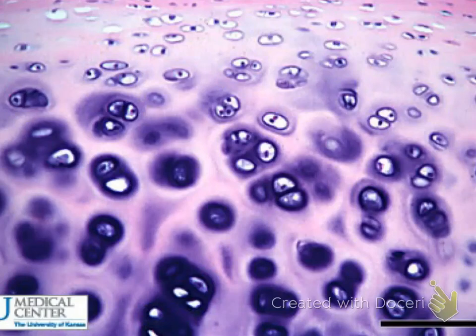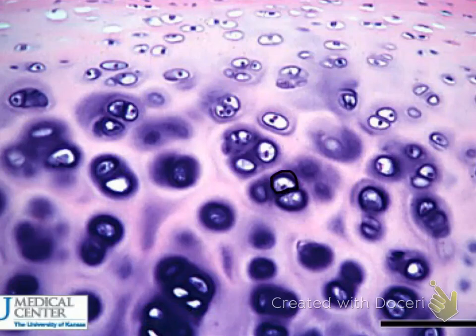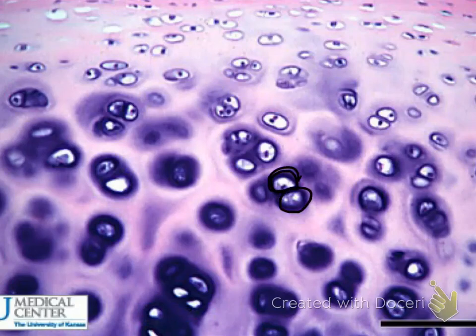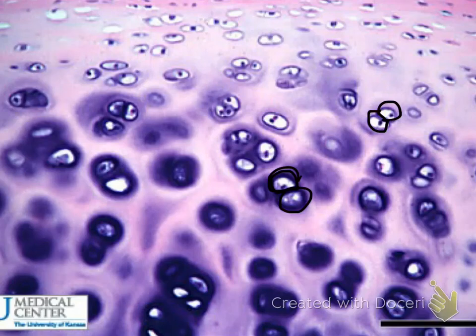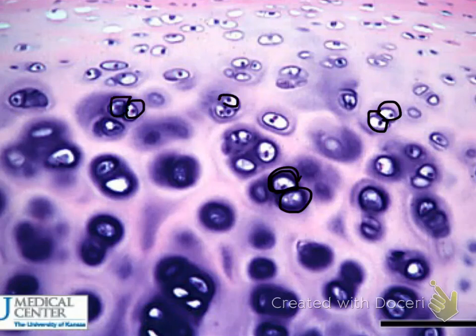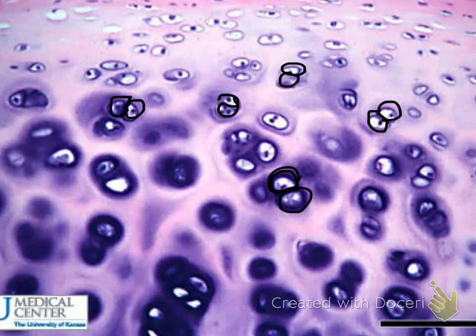The first thing you notice about these cells is a cluster of two cells. You have one there, you have one here, you have one there. They almost look like little eyes — a bunch of eyes everywhere. Whenever you see that double cluster of cells, you are looking at a cartilage tissue.